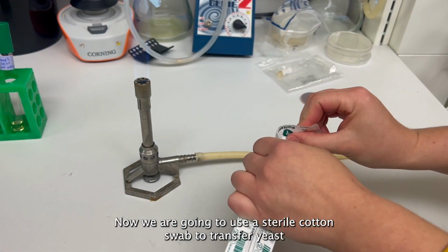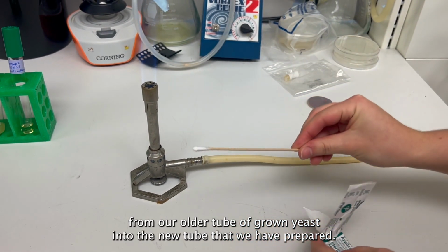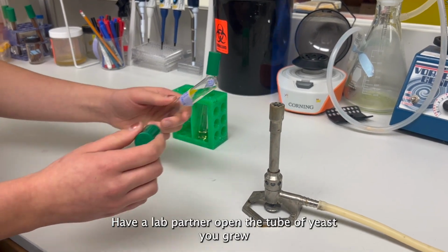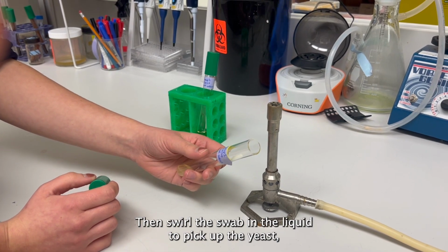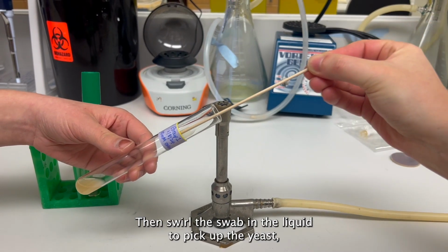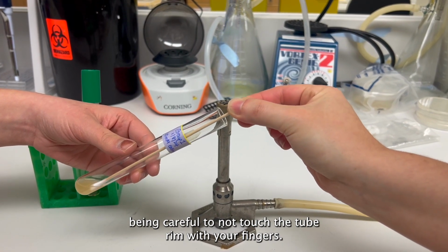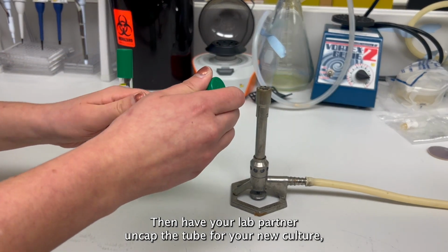Now we are going to use a sterile cotton swab to transfer yeast from our older tube of grown yeast into the new tube that we have prepared. Have a lab partner open the tube of yeast you grew near the Bunsen burner while you open a sterile swab. Then swirl the swab in the liquid to pick up the yeast, being careful to not touch the tube rim with your fingers.